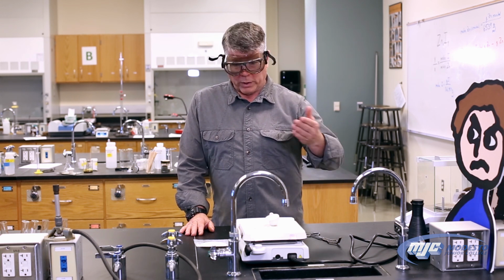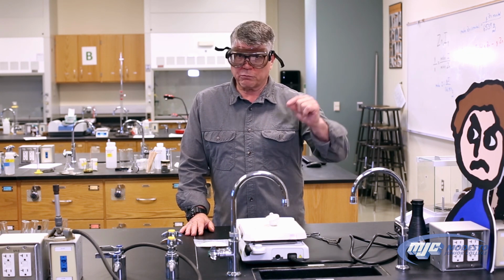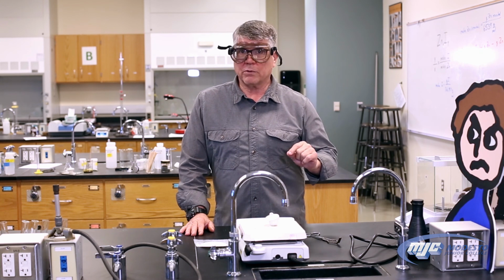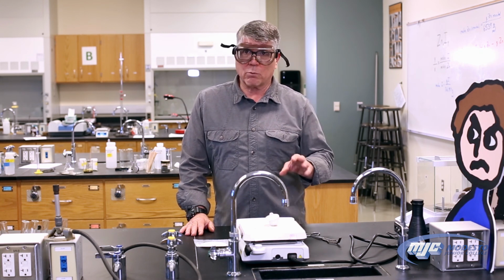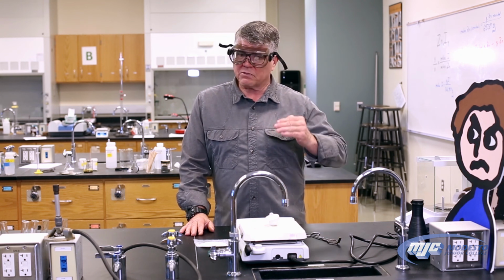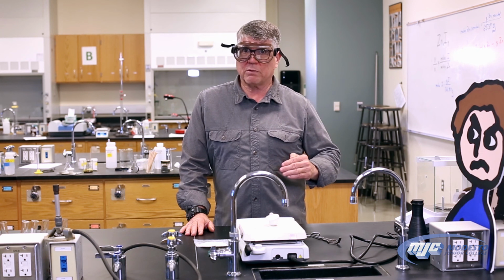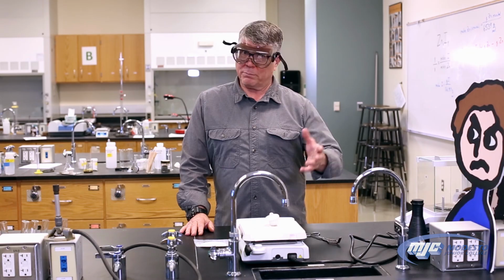If not, we're going to heat it another 10 minutes, weigh it, and compare the 2 most recent masses. If they are close enough to each other, within 0.01 grams, we can stop. Shouldn't have to do that more than 2 times. But we want to definitely get 2 consecutive weighings within 0.01 grams of each other. Once we get that, we have everything we need for this experiment, and we're finished.